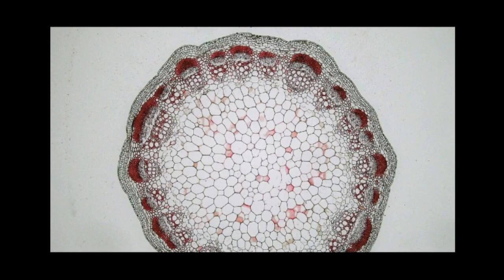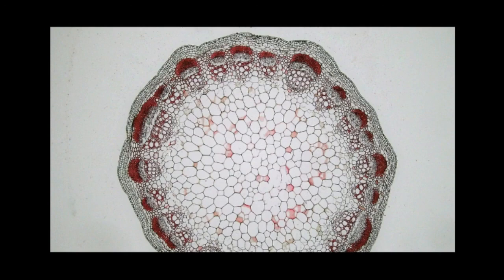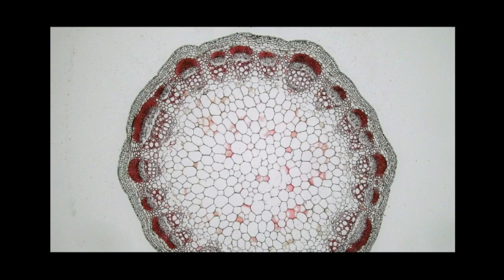When you observe the cells under the microscope, you can see many types of cells of different sizes arranged in the form of tissues. Some cells are hollow, some are very small, and there are some cells toward the outside which are very thin. We will be discussing how the cells are arranged in the stem and the different groups of arrangement in our next session.